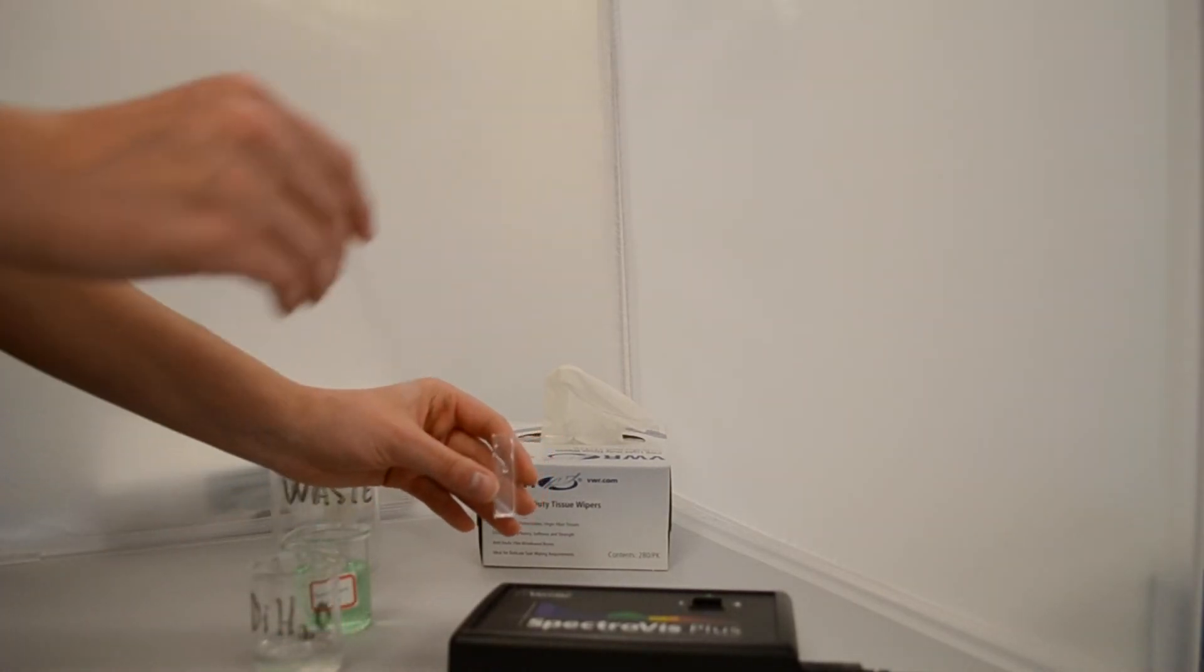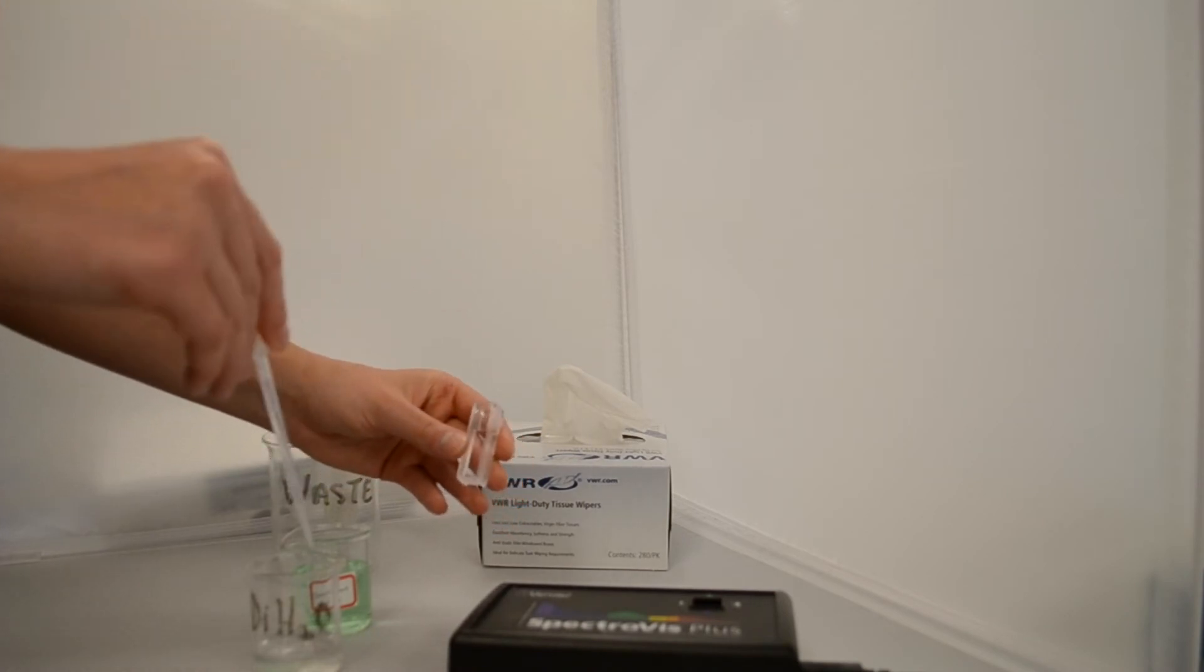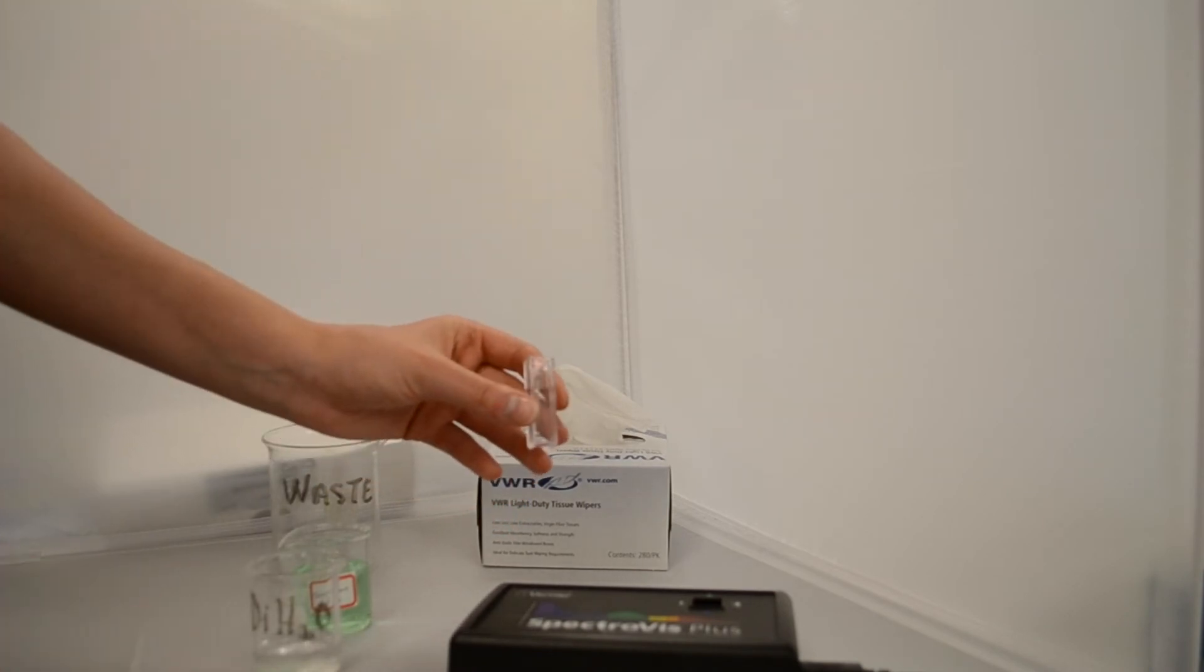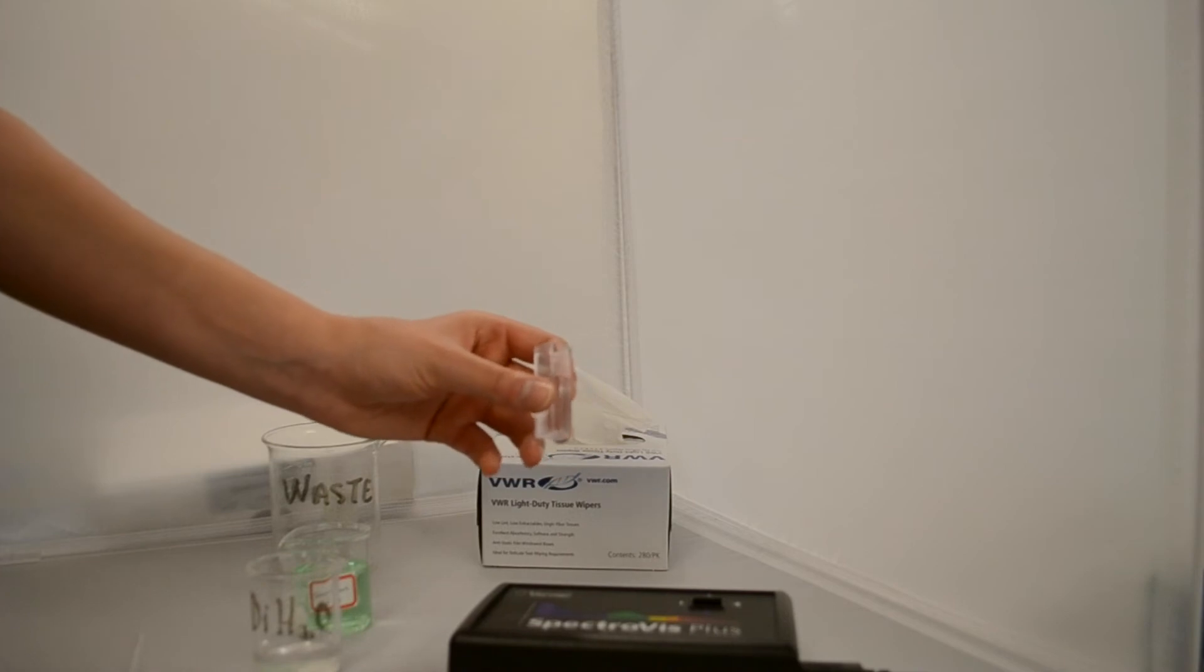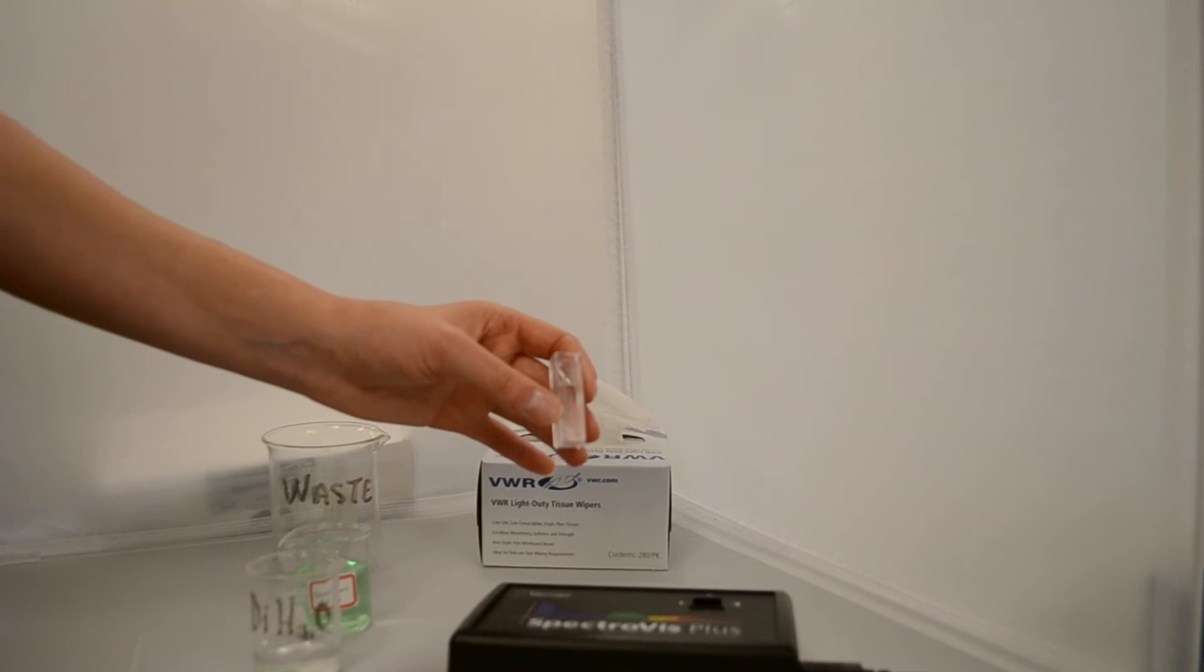However, in some of your upper-level courses, you may use a different blank. Fill your blanks with what is in your solution being analyzed but what is not being measured. In this case, we are trying to measure the concentration of food dye in the water, so we will be using water as our blank.